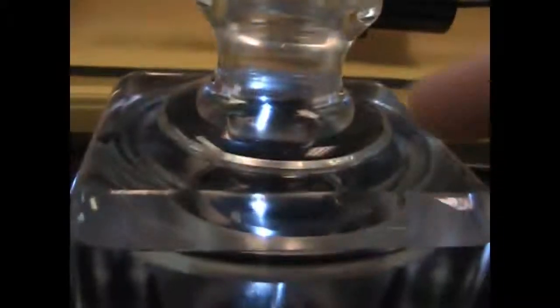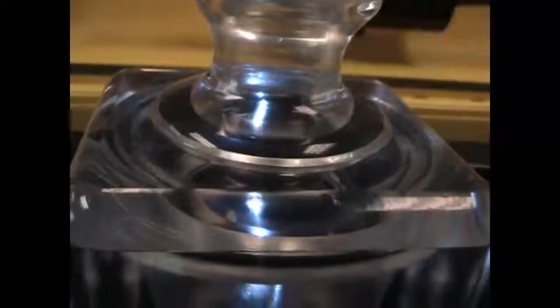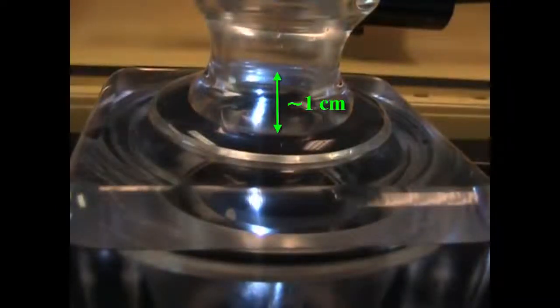Here you can see approximately where the water level should be. The goal here is to have the sample chamber completely fluid filled when the ultrasonic probe is inserted. It is okay if some water spills from the top of the chamber when the ultrasonic probe is inserted. Therefore, overfilling is less of an issue than underfilling.